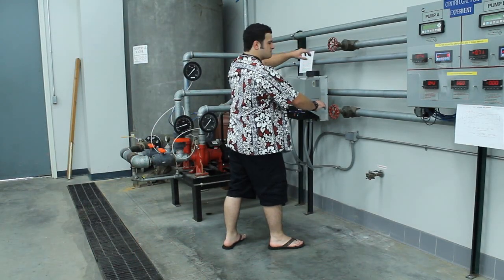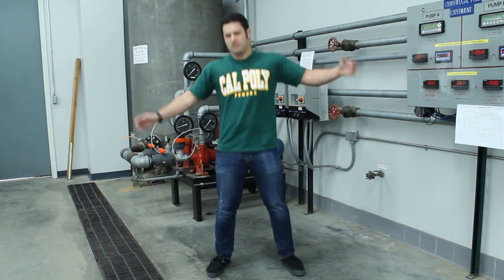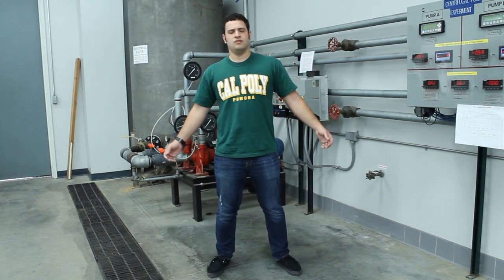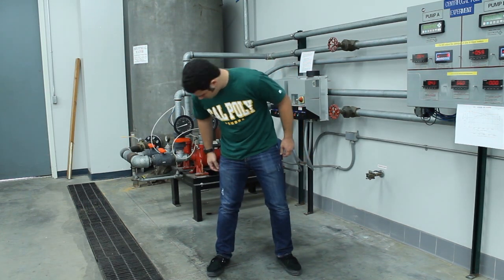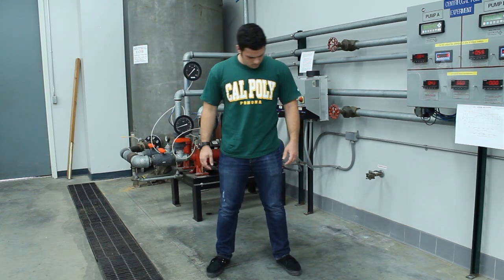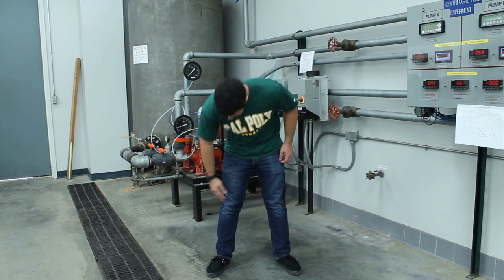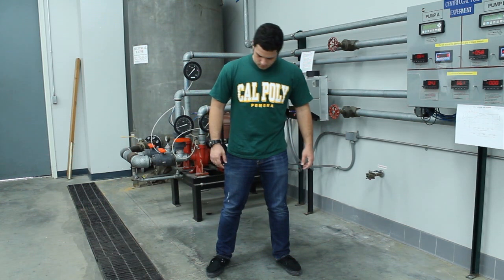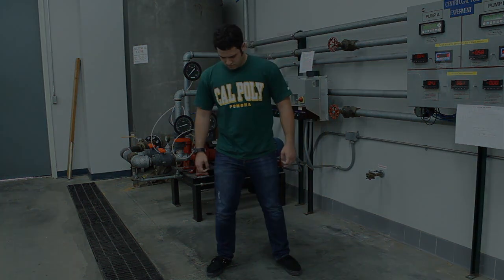Hang on a second. Before I let you do anything in the lab, you need to change your clothes. Much better. Now your shirt isn't loose and baggy. Your jeans cover your legs. You don't have any loose jewelry or clothing that can get caught in machinery. And your shoes protect your feet from falling objects and spilled liquids. Now let's review the emergency procedures and equipment.